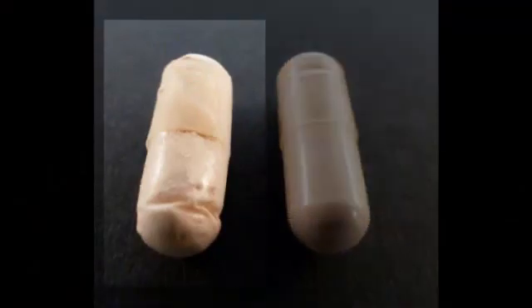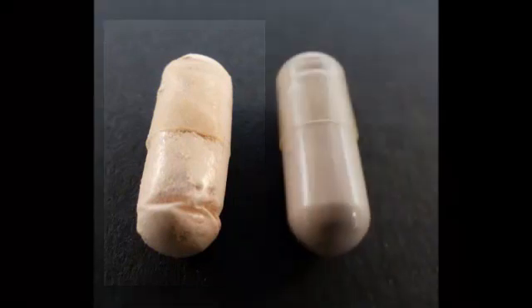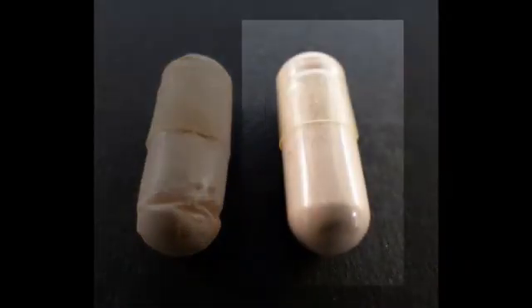This is an example of an unacceptable capsule because the surface is dull and gritty looking. It is also overlocked and dented, and the powder has not been evenly distributed. This is an example of an acceptable capsule because the surface is shiny, it is properly locked, and the powder is evenly distributed.